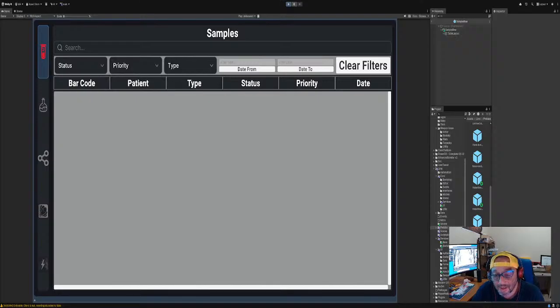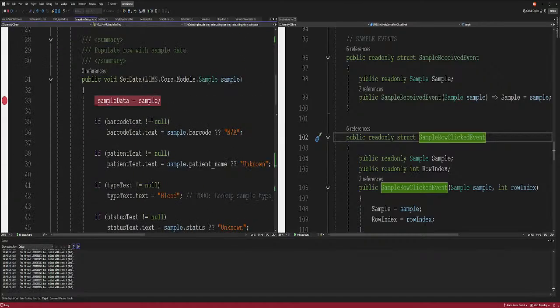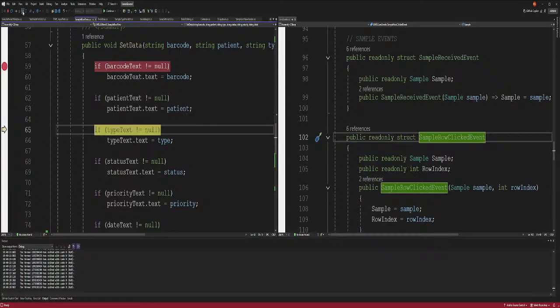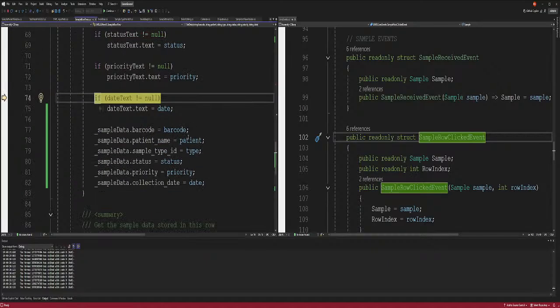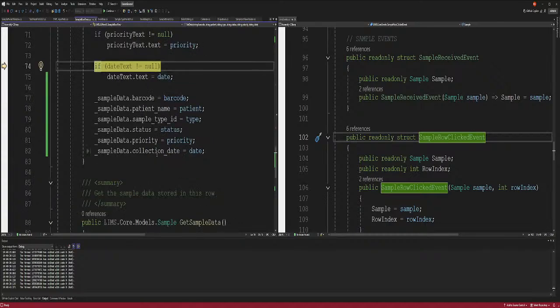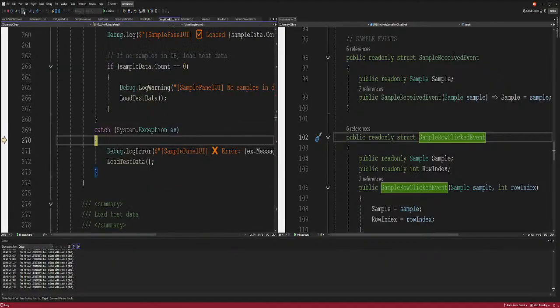Okay. So anyway, just to round up what we did: we found out that this set data is the one that's actually setting the data. This is not, for whatever reason. Okay, here we go. Now we're starting, right? So now we've got the barcode. We've got the data. It's going through all of them. Okay. So all of them got their normal ending, the type, blood. What's this one? Barcode. Okay. So this one is wrong and this one is wrong. We'll fix that later.